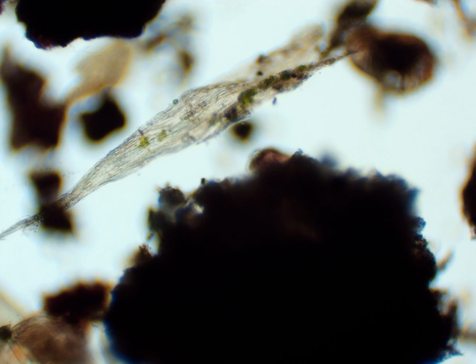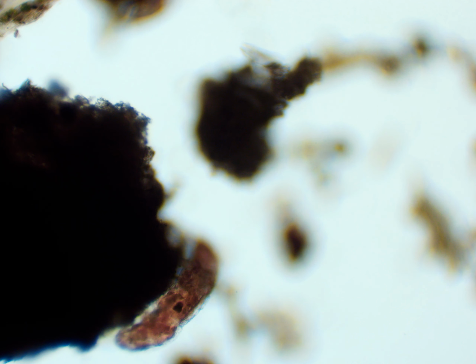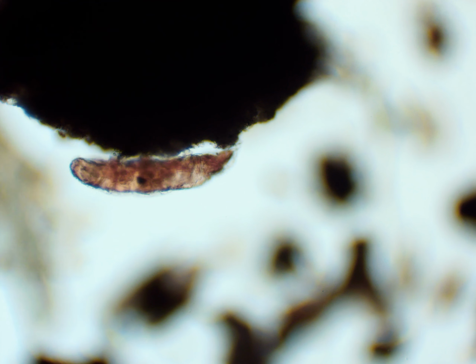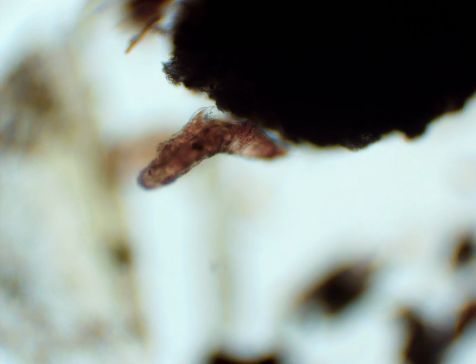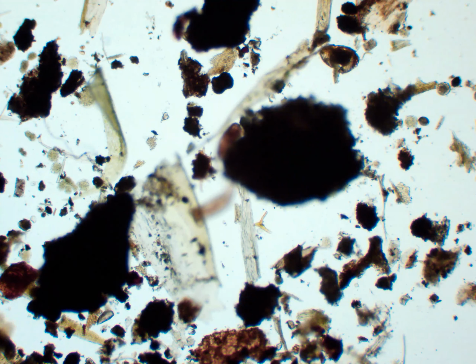And I believe this is the order that goes into a tun instead of a cyst, which is why its skin is like that. The reason it goes into this tun is so when the water dries up, which it lives in, it can live in a tun until the water forms back, like in the morning, for example, in morning dew from the condensation.